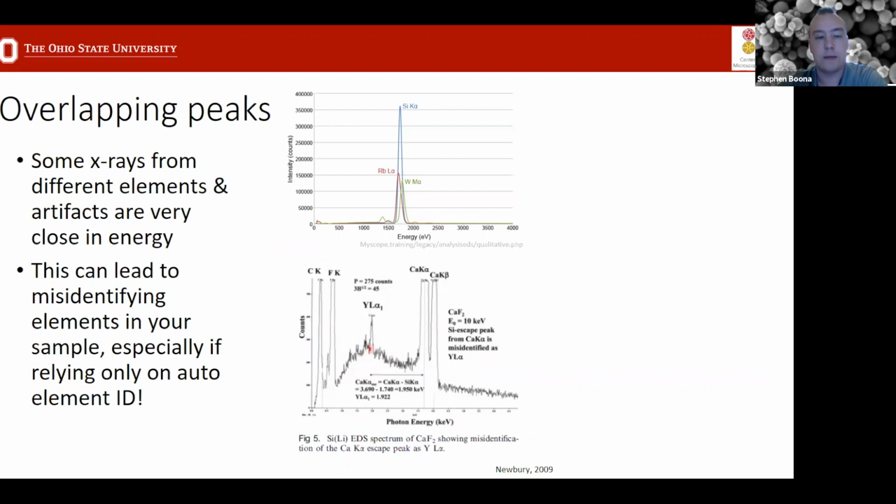The giveaway sometimes is that this would show up everywhere you would see calcium, and vice versa. There would be no places in the sample that would have yttrium without calcium and calcium without yttrium, because these two are actually essentially the same peak, but just differentiated by that artifact process.